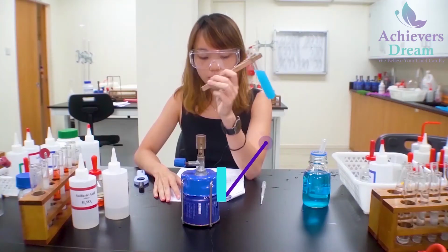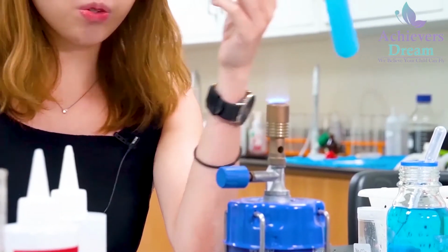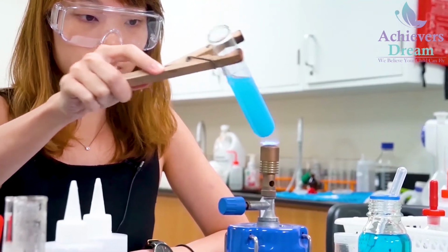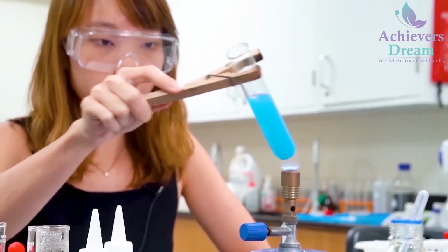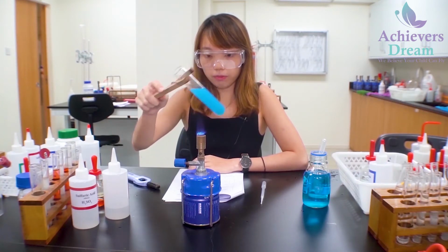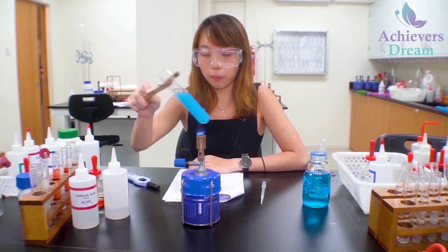Okay, so the next part is to strongly heat this boiling tube so that the mixture in it boils vigorously for at least 2 minutes. Okay, so you can start to see your blue precipitate is slowly turning to black solid or black precipitate.